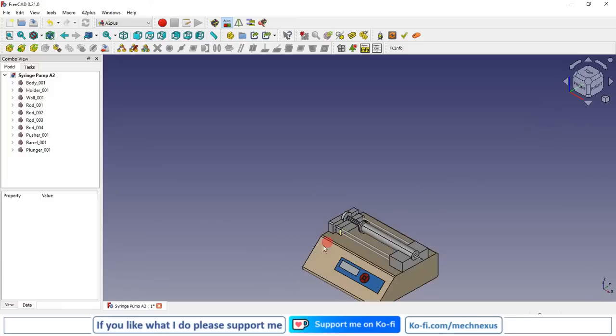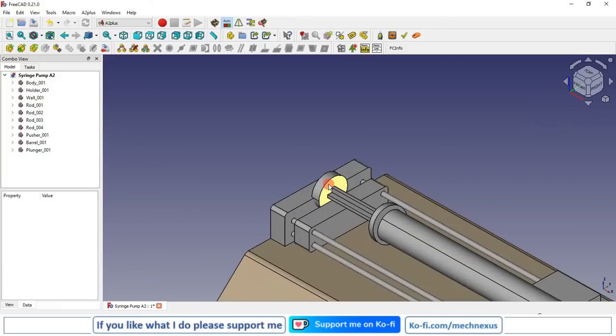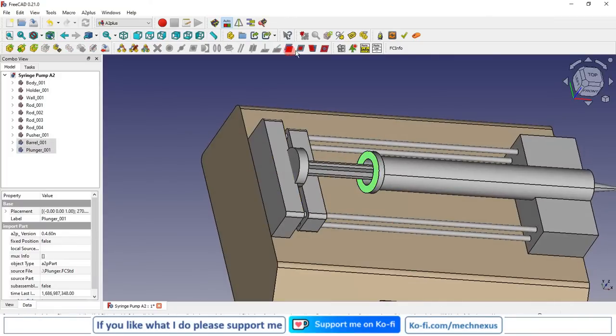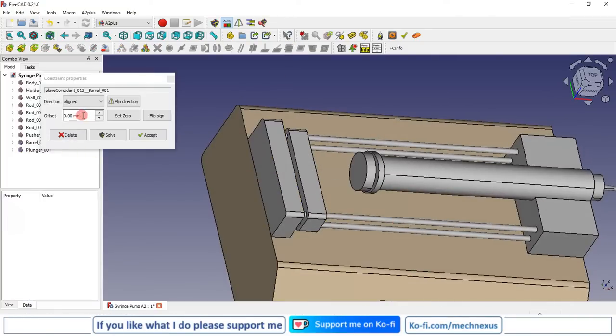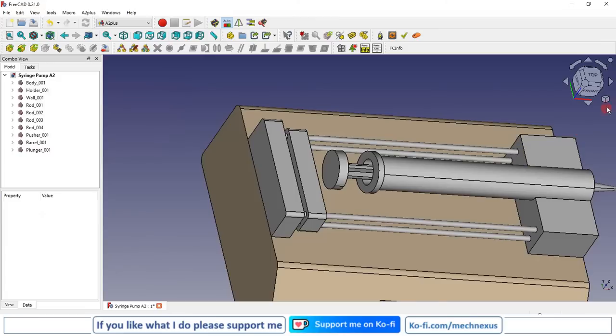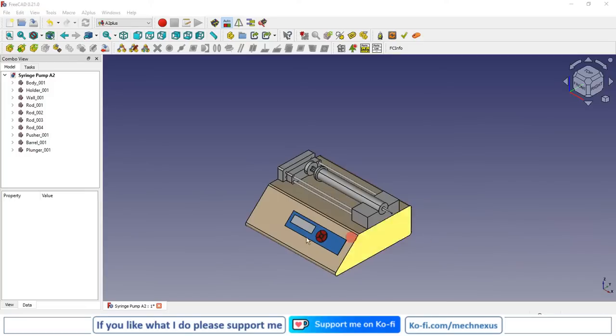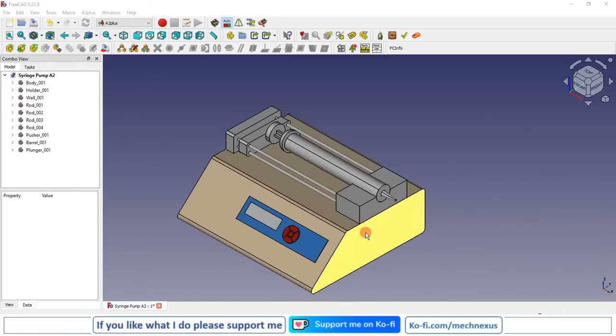First I will switch to the isometric and I will give the distance constraint between this face and this face. So I will select this face and this face and I will give the mate, and distance I will give the 15 mm but in minus direction and I will accept it. Now I will switch to the isometric view. So this is how we have made the syringe pump assembly in FreeCAD.